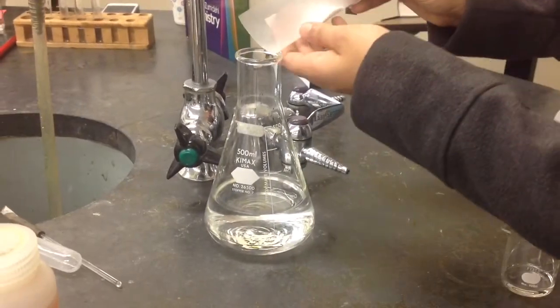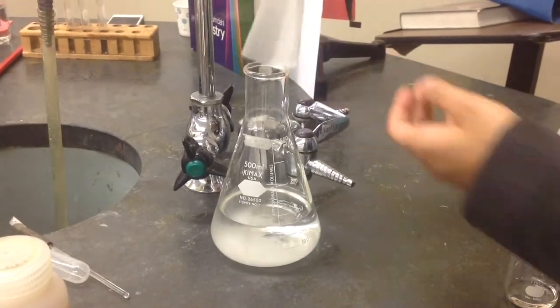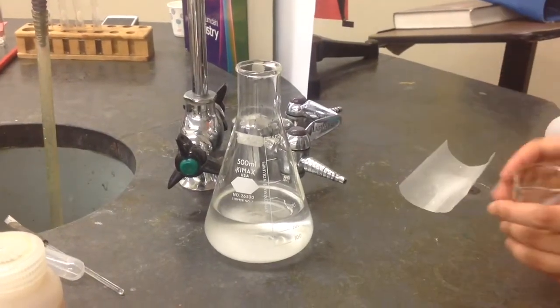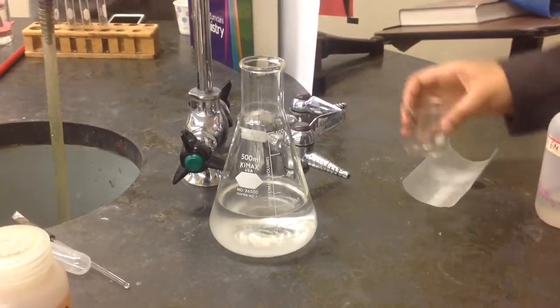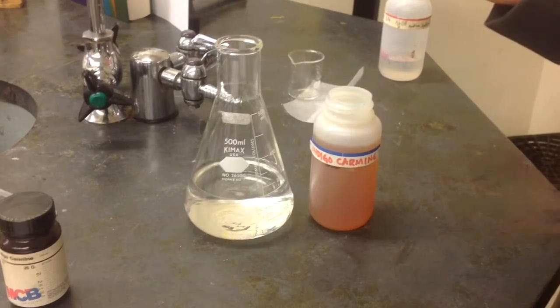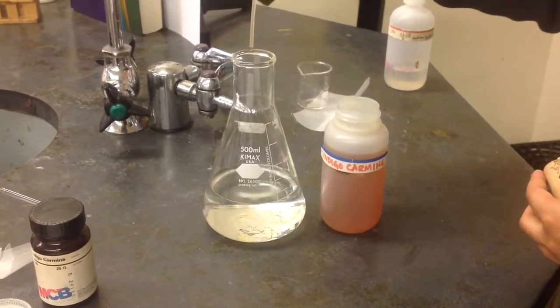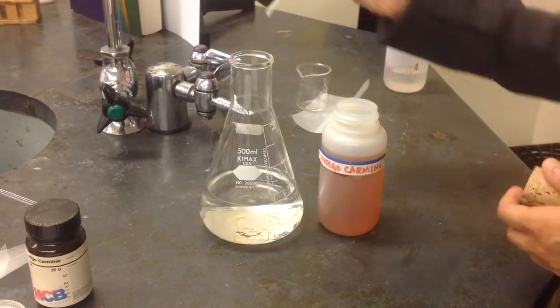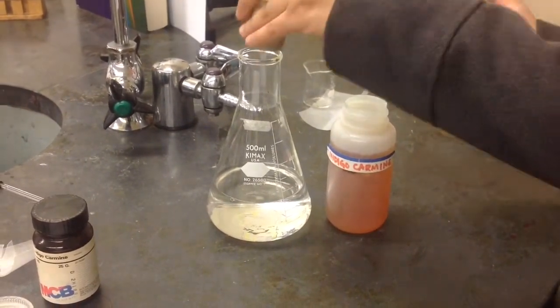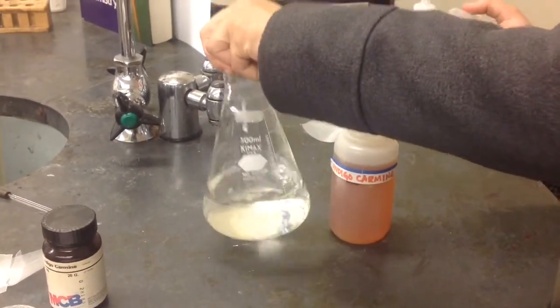To begin the lab, add your glucose into your distilled water, and then add your 6-molar NaOH to the solution as well. Next, add a few drops of the indicator, indigo carmine, to your solution. Once done, cork your flask and give it a few gentle stirs. It will take about 10 minutes to turn a yellow color.